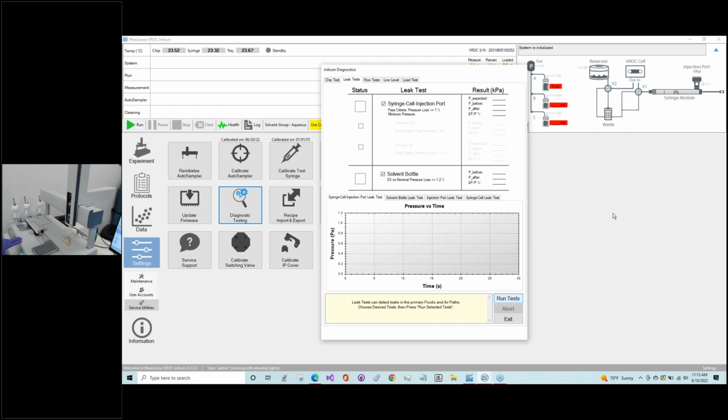And then the second one, the one below here, is the solvent bottles. As Marina just explained, there's a lot of opportunity for leaking over here with all of the tubing connections and the caps. So you need to check to make sure that these are pressurizing properly, so you have the correct flow during all of the cleaning processes. So that's the second one that we're looking for.